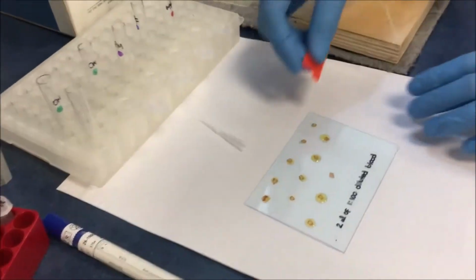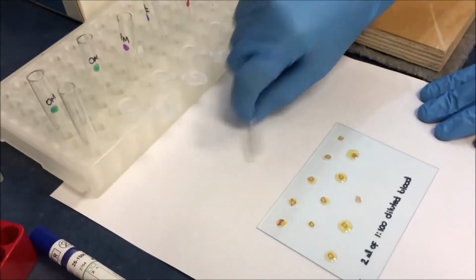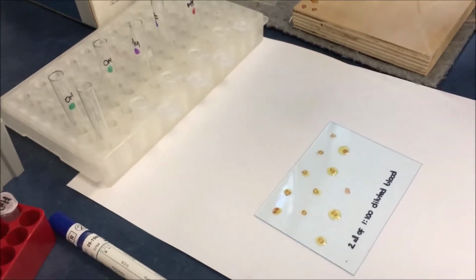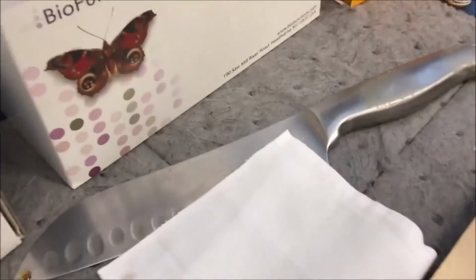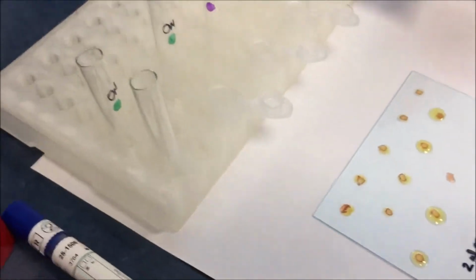These are the samples which were previously applied with the Omni-Matrix, and we let them dry for 3 to 5 minutes. The drying process takes about 3 to 5 minutes, depending on the humidity of the environment. Similarly, the spray which we sprayed on the suspected fingerprint area would also have dried in 3 to 5 minutes. Now we are going to show you how to pick up the sample.